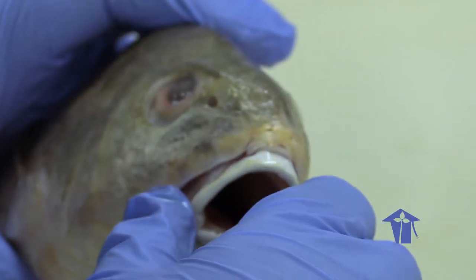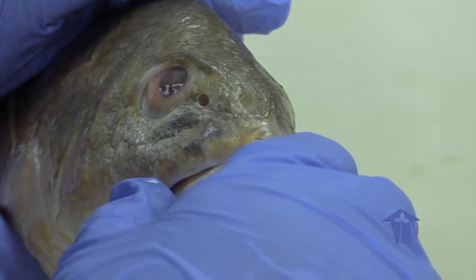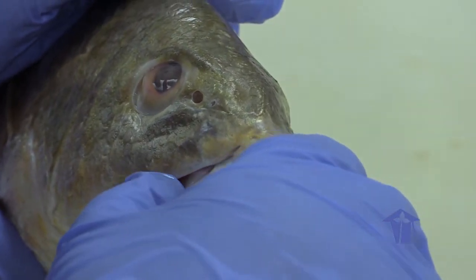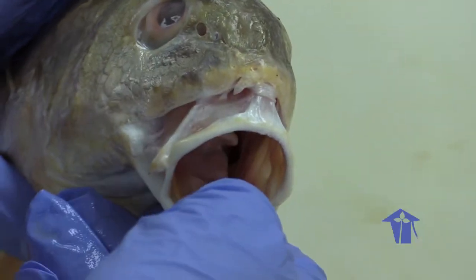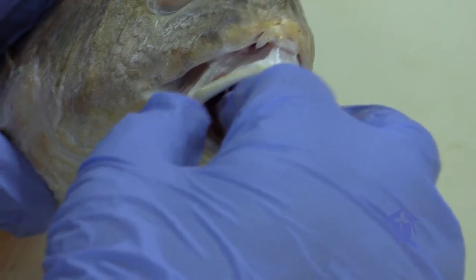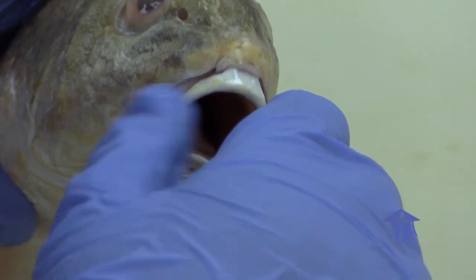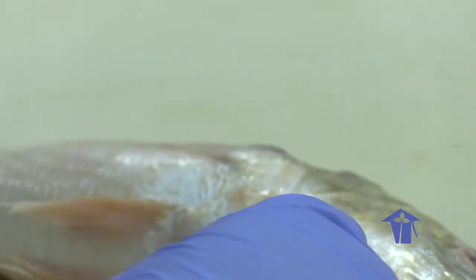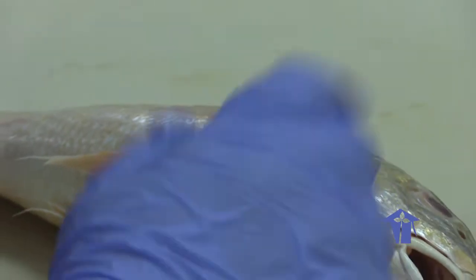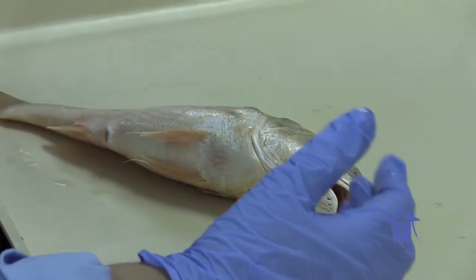In fact, there is a species of parasites called Cymothoa exigua, which is an isopod that replaces the tongue in snappers and some other fish, and the fish doesn't even know that its tongue has been replaced because the tongue is not really a gustatory, labile, movable structure as with our mouths.